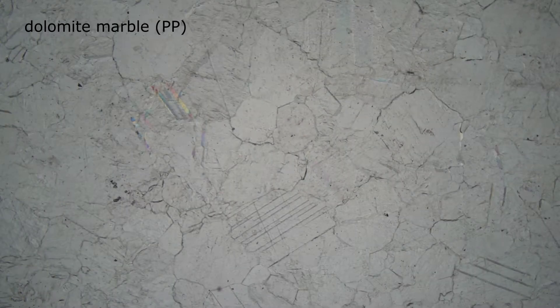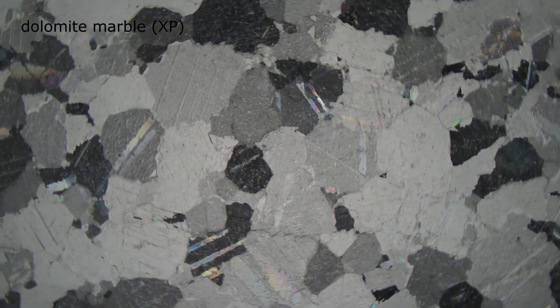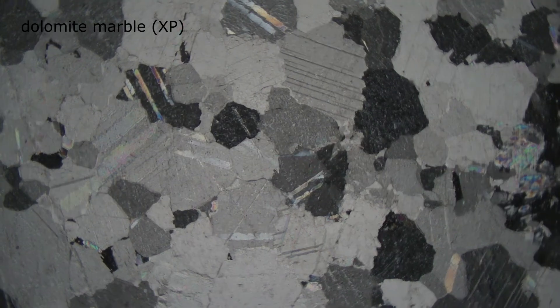Here is a view of a dolomite marble in plain polarized light. The vague stripes you can see are twinning. Most minerals only show twinning in cross-polarized light, but dolomite and calcite show it in plain polarized light. And now we insert the upper polarizer to get cross-polarized light. Dolomite has exceptionally high birefringence, so the interference colors are very, very high-order washed-out pastels, almost appearing white.